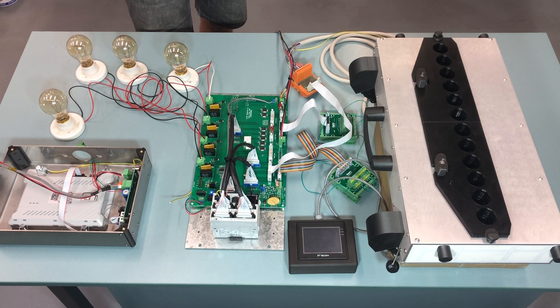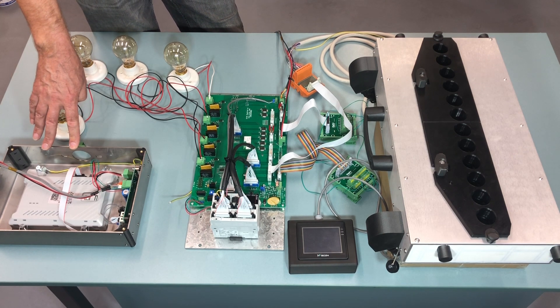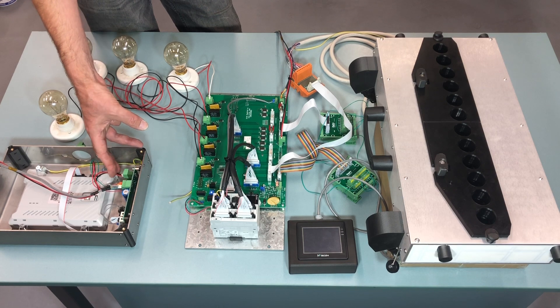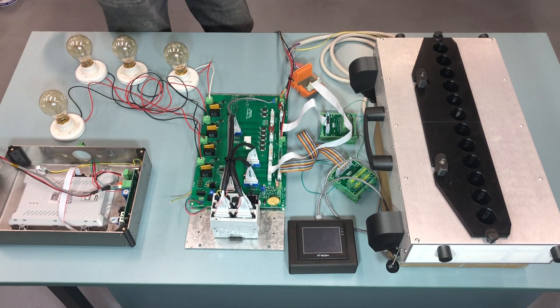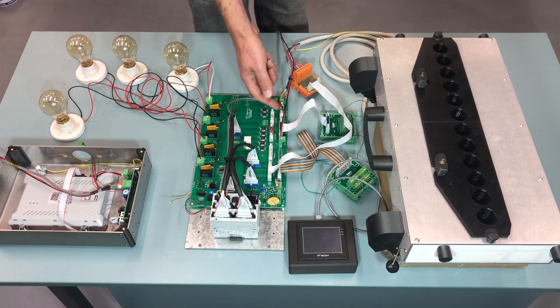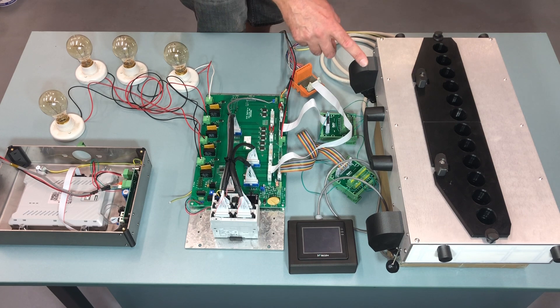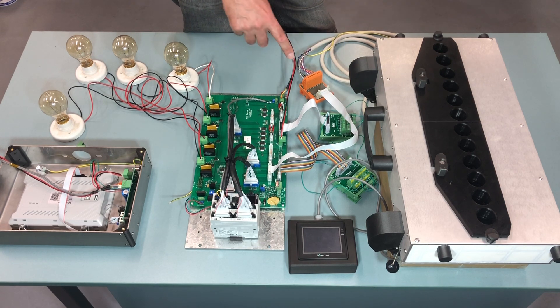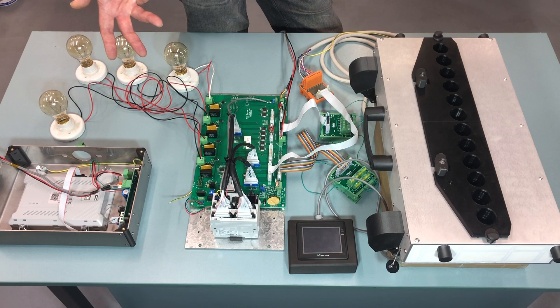Here you can see the test cable that I supplied for the HMI. The HMI can work on 12 volt AC as well as 24 volt DC. The original HMI on the post on your machine is 12 volt AC, so once you mount it on that post, you will connect it up to the 12 volt AC power input. But for testing, you just put it on a table, connected with that supplied cable, and then the communication goes in here and the 24 volt DC we take from there. The same with the counting head — you just leave the original cables in your machine for the moment, put this cable outside, and just connect it up this way so that you can test it without having to commit to the full installation at that time.